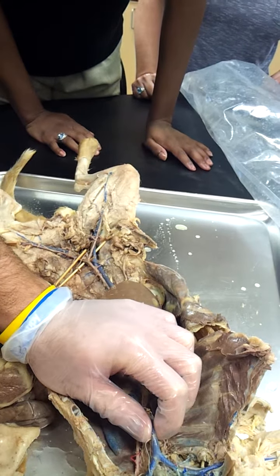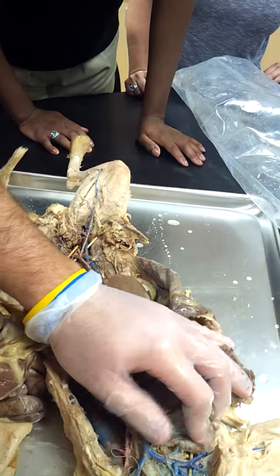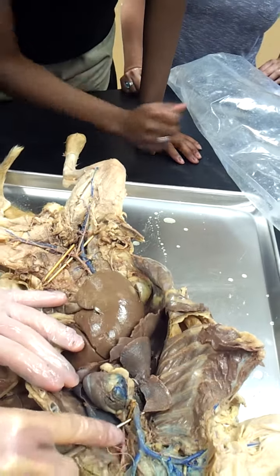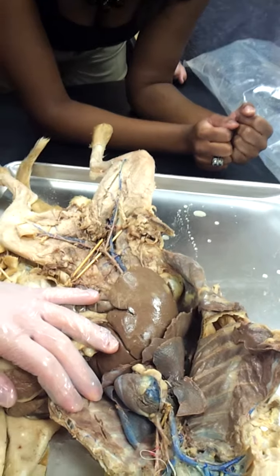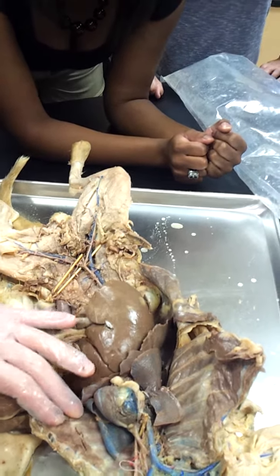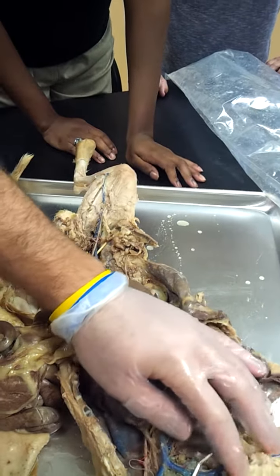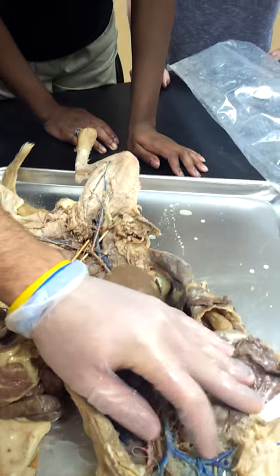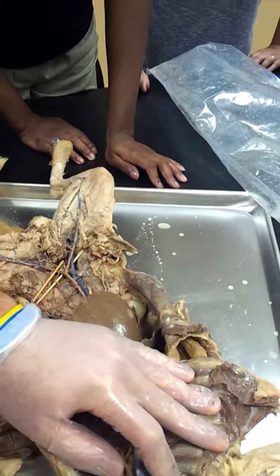Brachiocephalics, right and left. Make sure you always label right and left when you can on this exam. So we have the SVC going into two main branches, same setup in the human. Brachiocephalics, right and left. From there, our brachiocephalic. Brachial means arm, cephalic, head. So the two portions. The portion going to the arm is referred to as subclavian, and the portion going to the head, jugular.